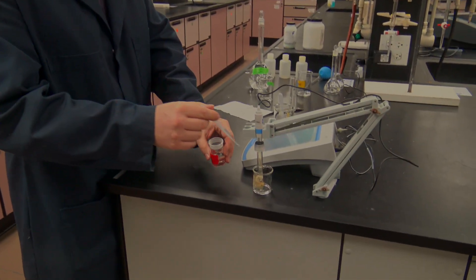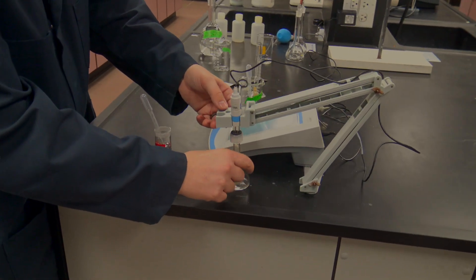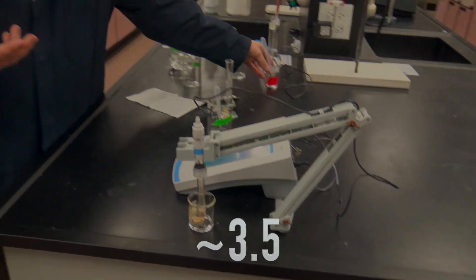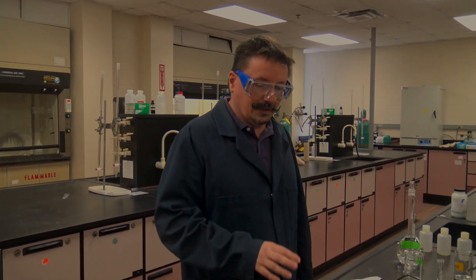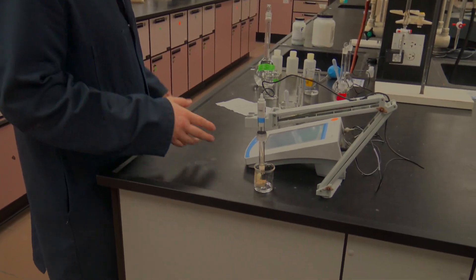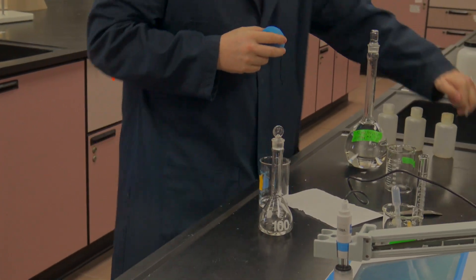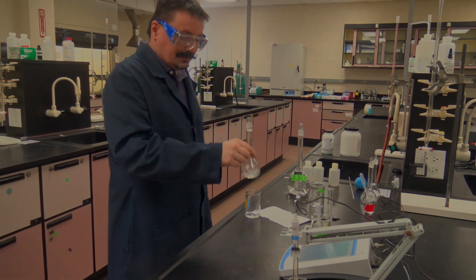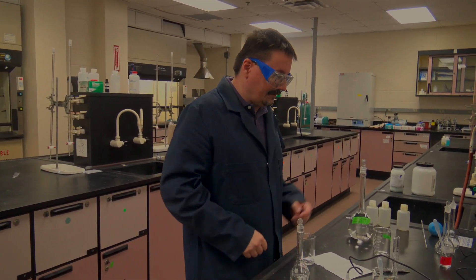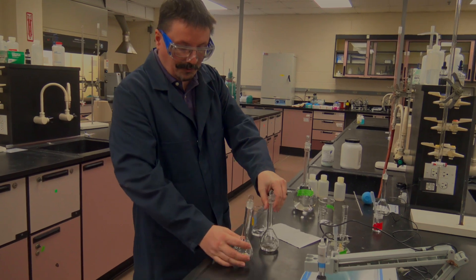About five or ten drops at a time, add sodium citrate to the 10 milliliter iron aliquot, mix thoroughly, and check the pH again. You should see the pH slowly rise. Once it's around 3.5 — anywhere from 3.45 to 3.7 is fine — you're done. Note how many drops it took; for example, if it took 36 drops for 10 milliliters of iron, then for 5 milliliters you'd add 18 drops, and keep scaling down proportionally for the 2 milliliter and 1 milliliter aliquots.